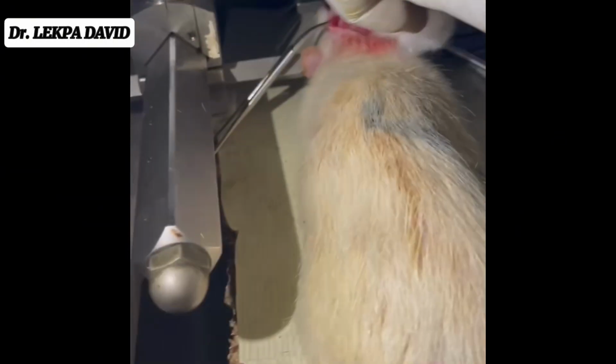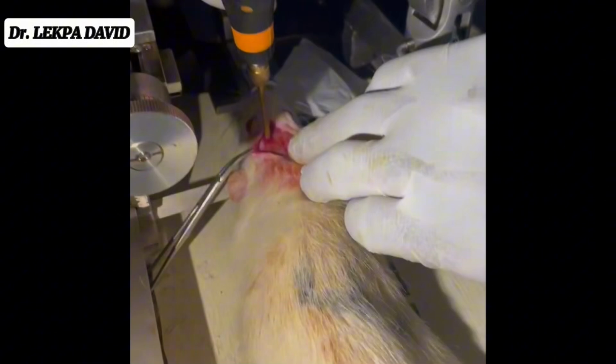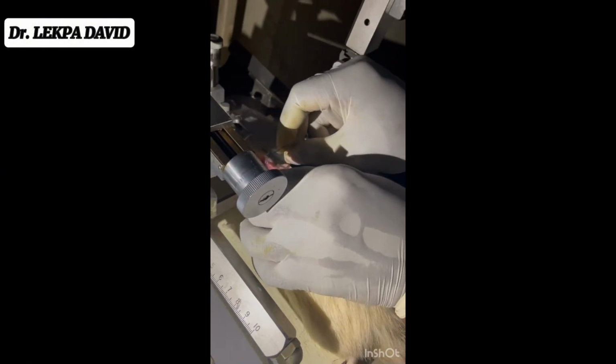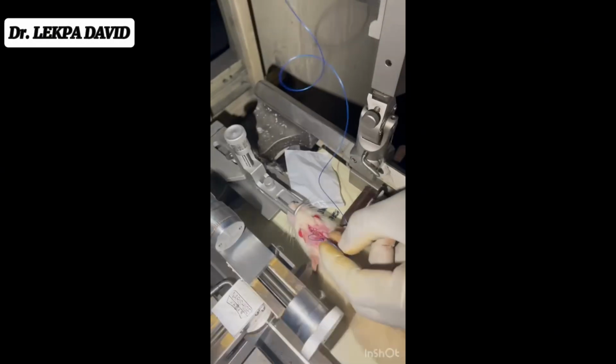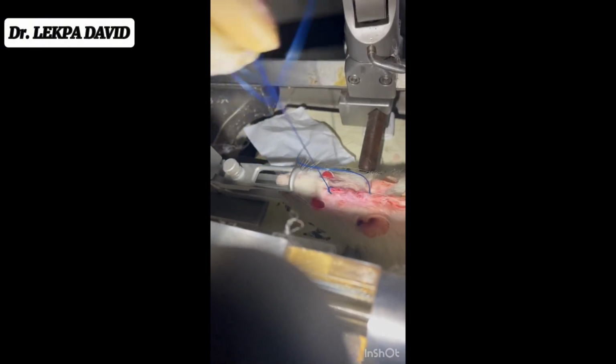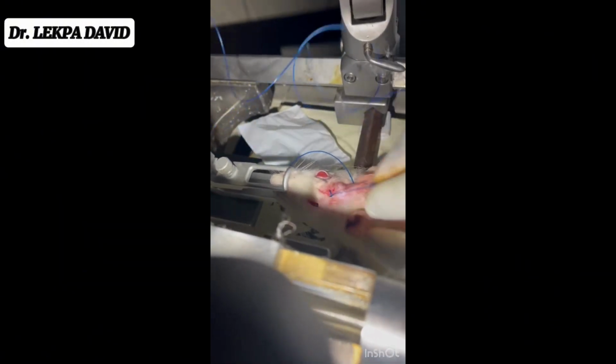This is me cleaning up, being very careful with the drill and all that. Now this is the opened space. We removed the top part of the skull, exposing the brain, after which we caused an injury to the motor cortex of the brain. Now this is me stitching up after we applied paraffin wax to cover up the hole we created. So we stitched up, although not great work, but it did the work properly.